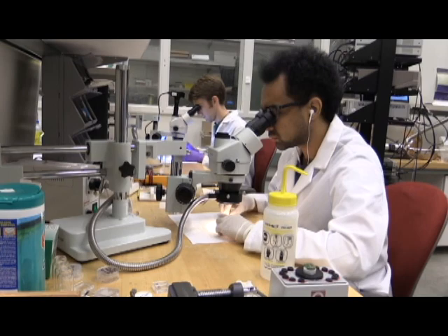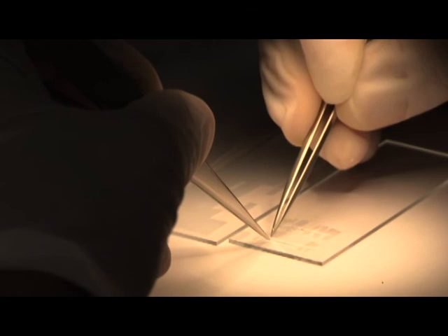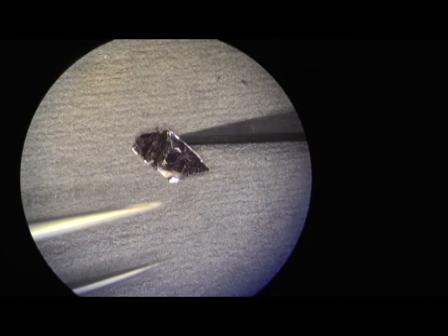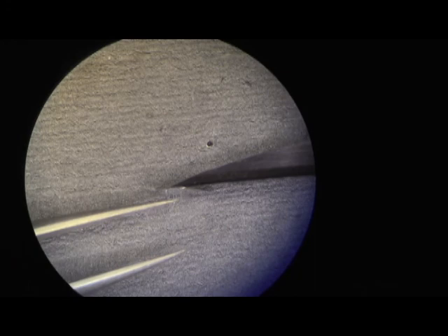We do all of our crystal work under microscopes by hand using surgical blades and very fine tweezers. After cooling down, the crucible is broken open to reveal shiny crystals. The crystals are about a millimeter in size and are separated into thin sheets which are less than a tenth of a millimeter thick.